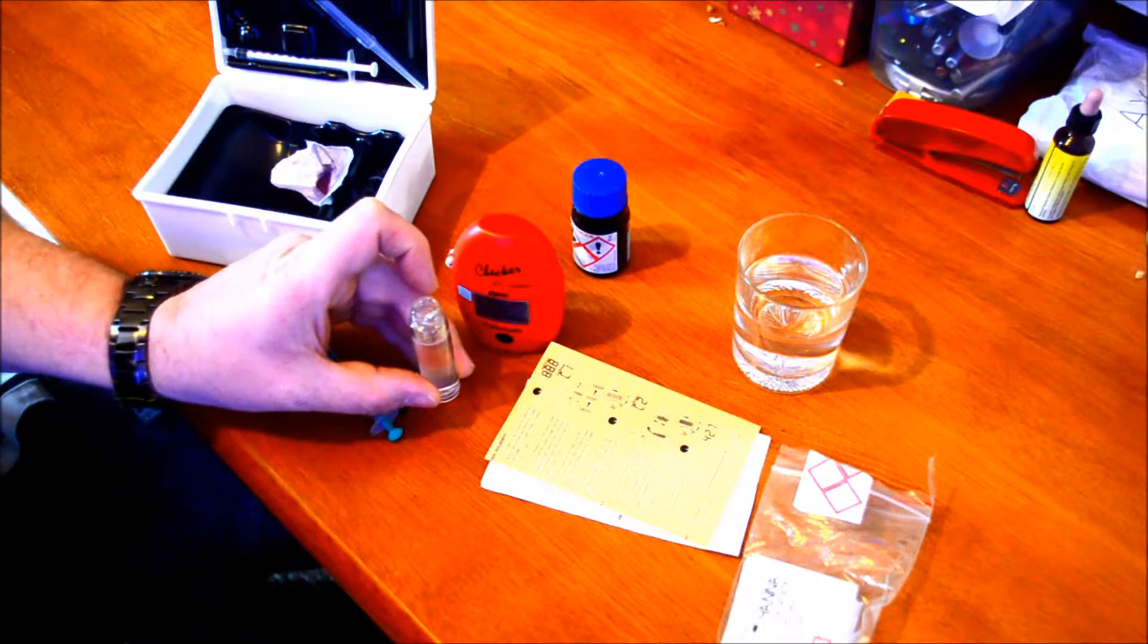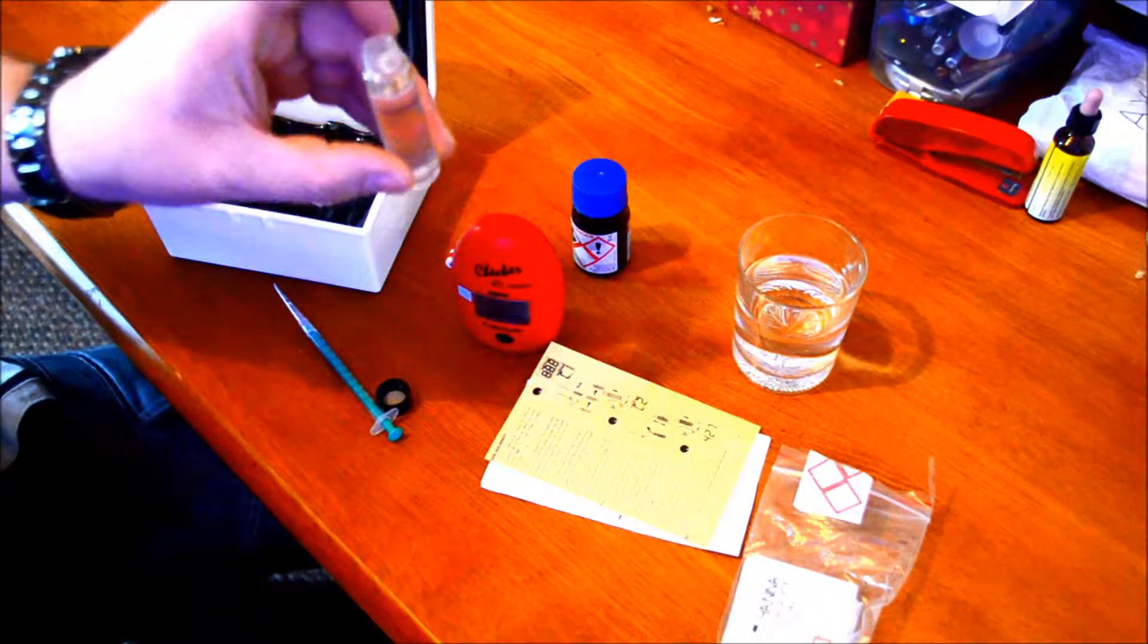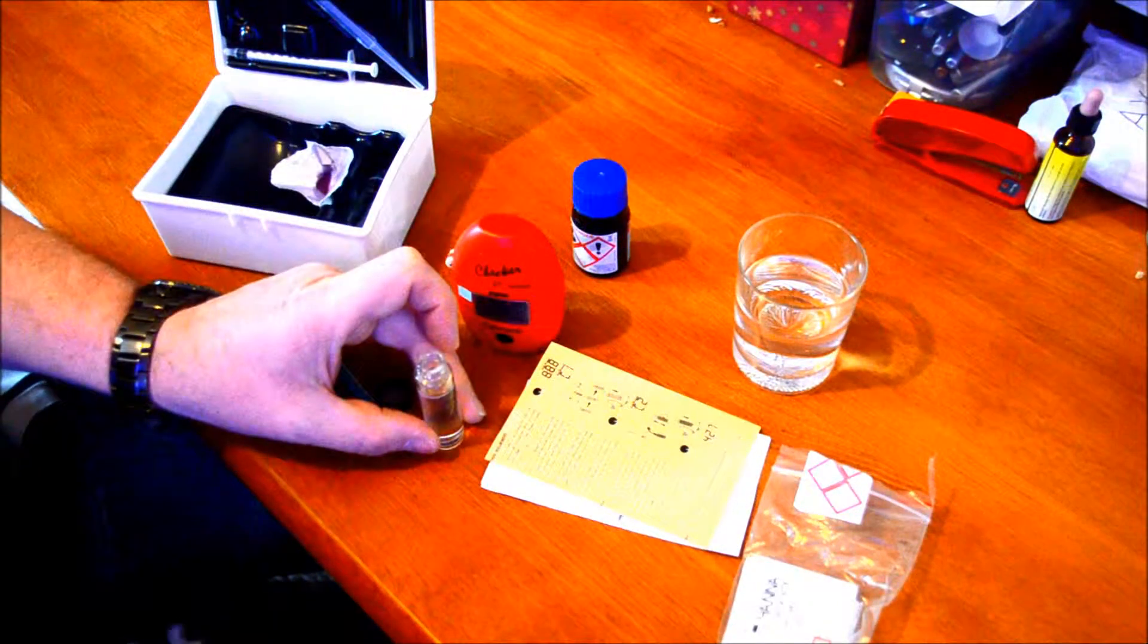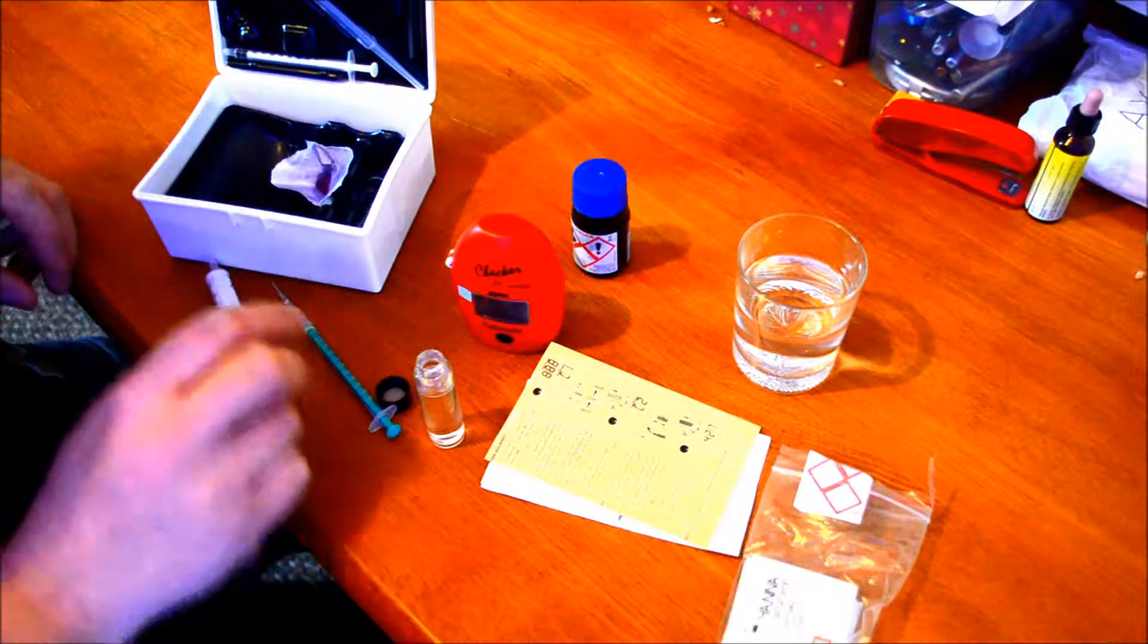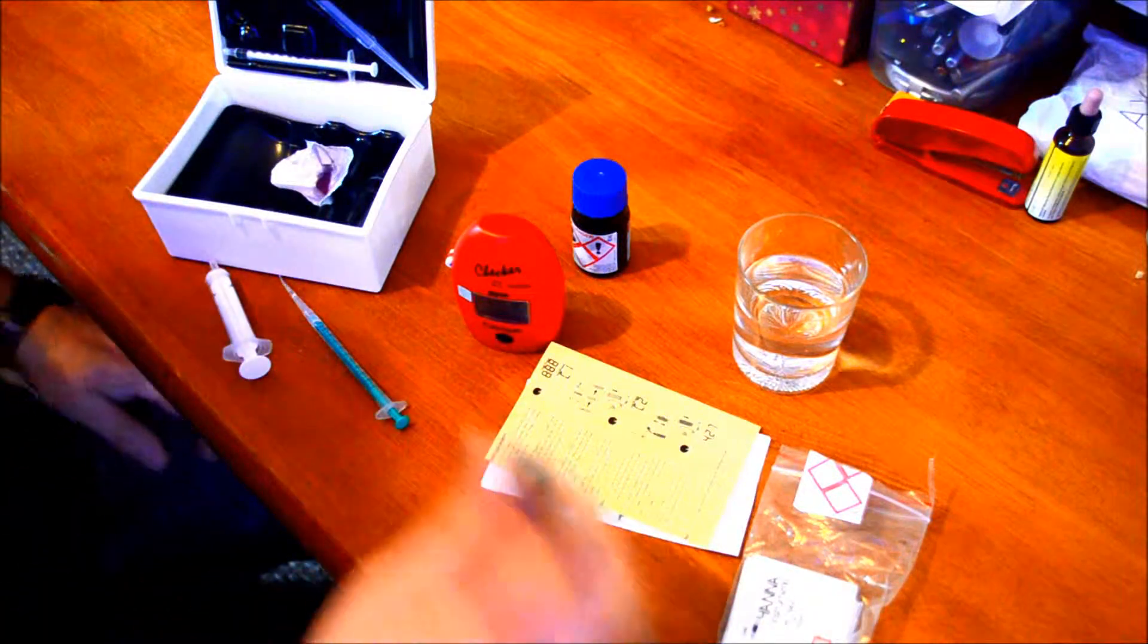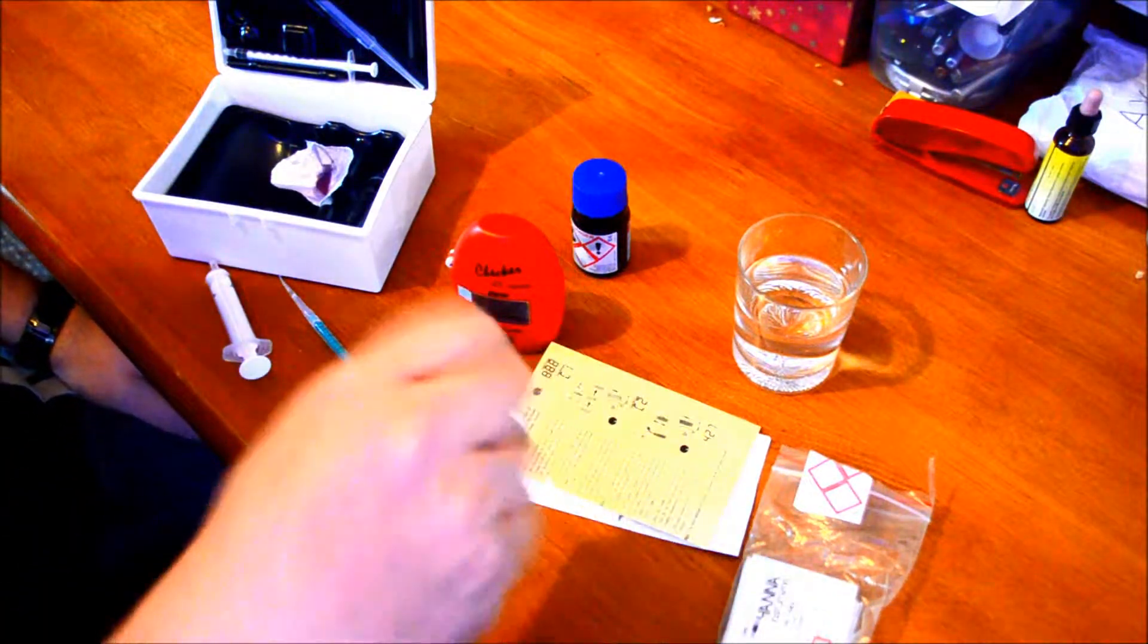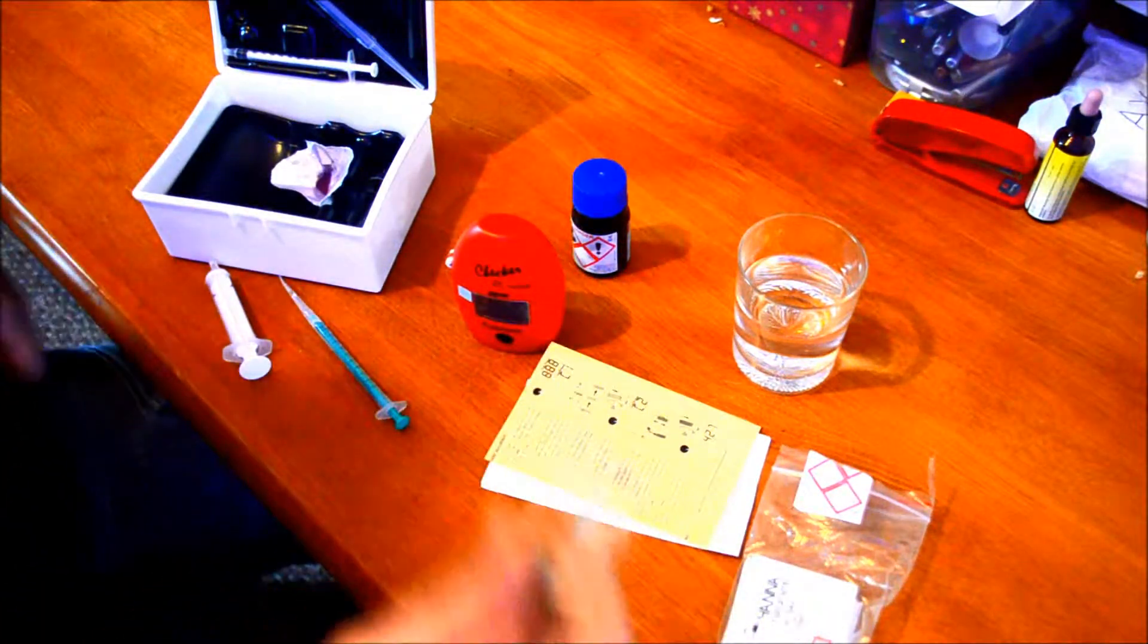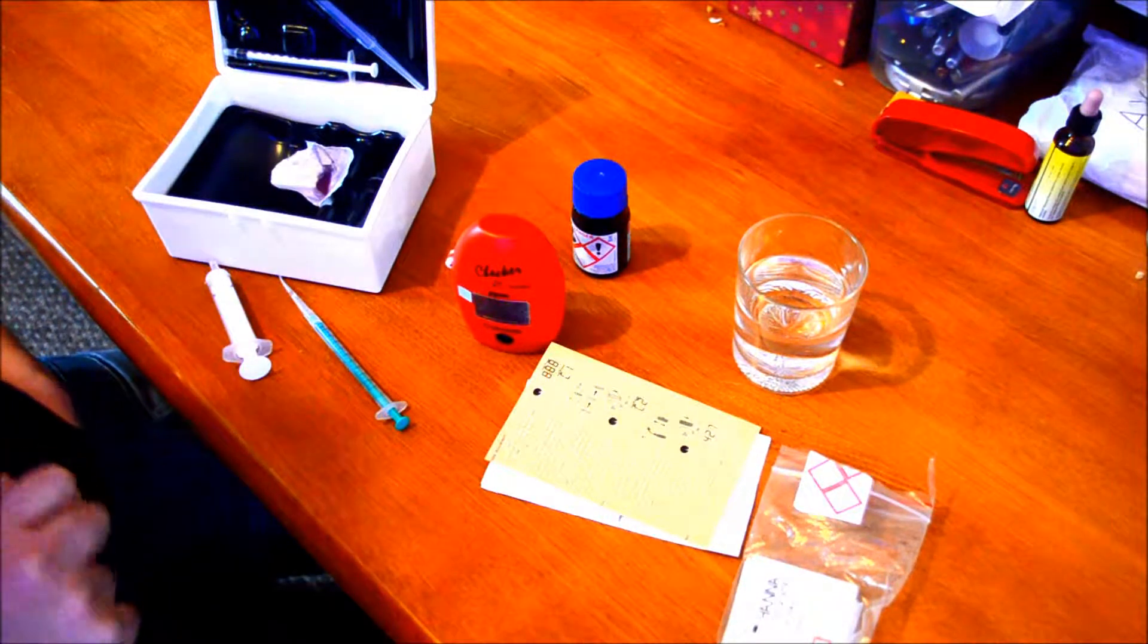As you can see, that's on the line of the vial. What you do then - it says you twist it like that, but I'll just give it a shake. I'll wipe the glass.